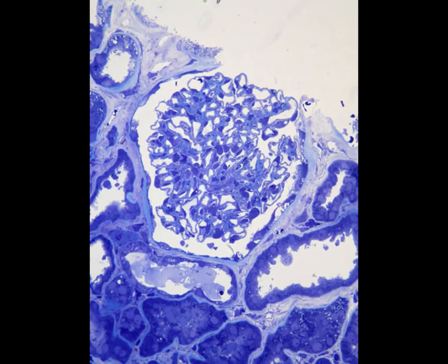Using the standard light microscope the sample can be checked for quality and any areas of interest. Here a kidney sample has been stained blue. The area highlighted in red shows a glomerulus which will be investigated for disease by transmission electron microscopy.